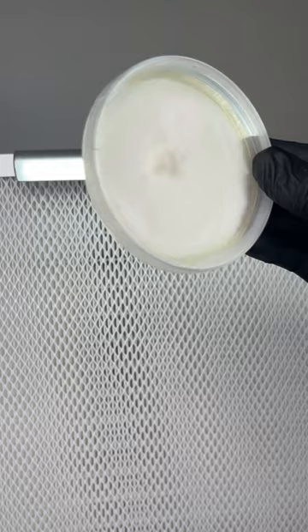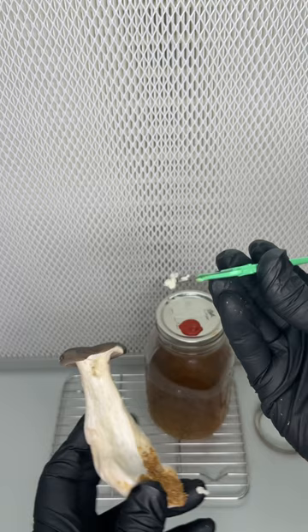Another way to get an identical clone from a fresh mushroom is to take that sterile tissue and add it to sterilized honey water.